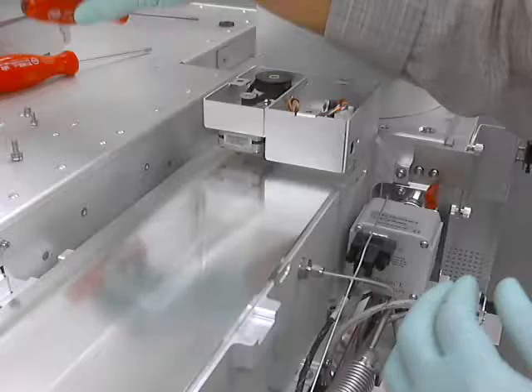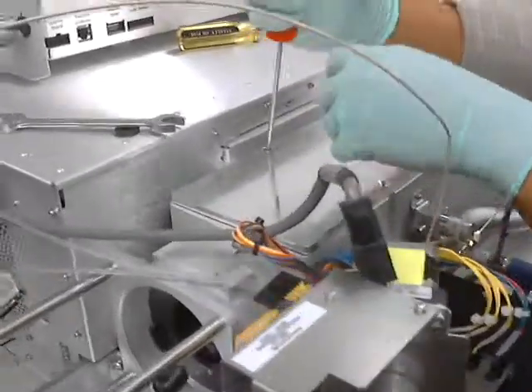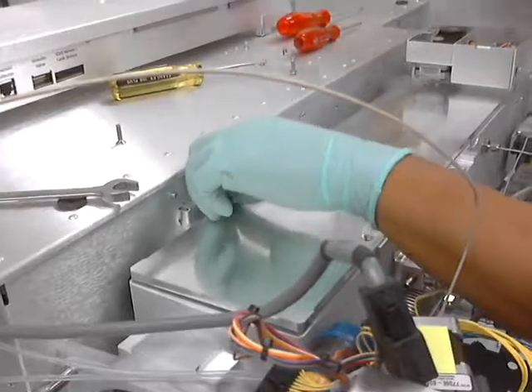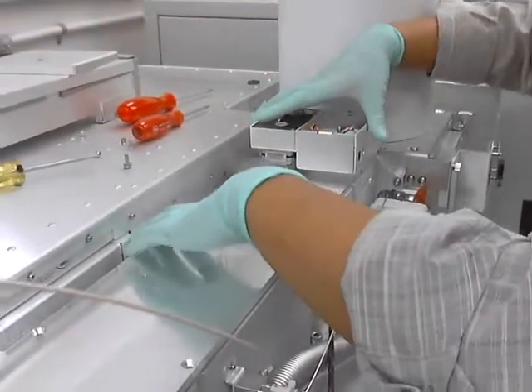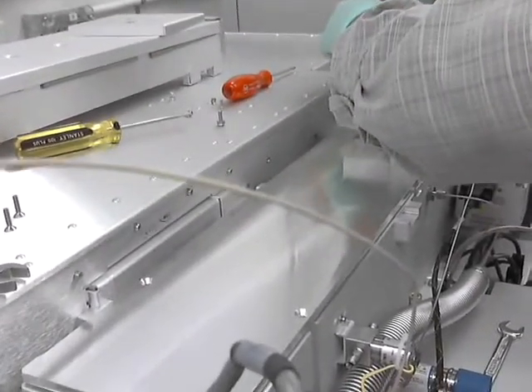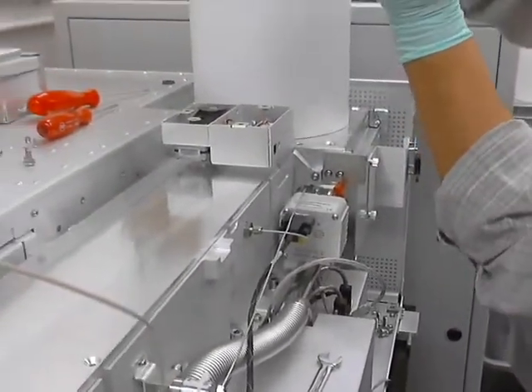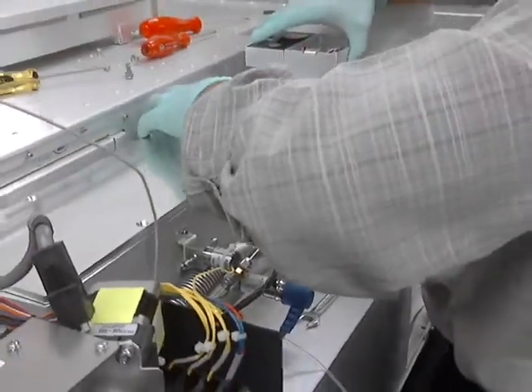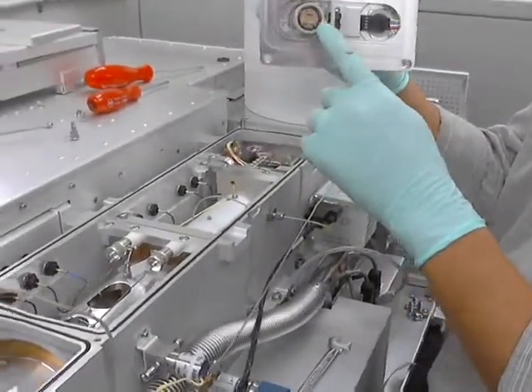Take that off. What do you call this whole assembly? This is just the top plate. But this is the slicer — it moves the slicer back and forth. That's for the mass spec — to select ions. The slicer pancakes the ions so that they're nice and flat. It's a very important part. This part here has to couple with that part — it's gotta be lined up.